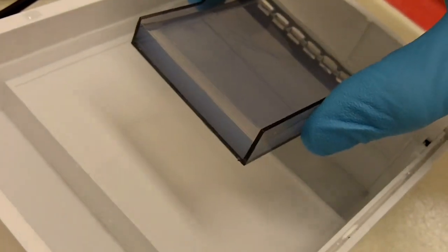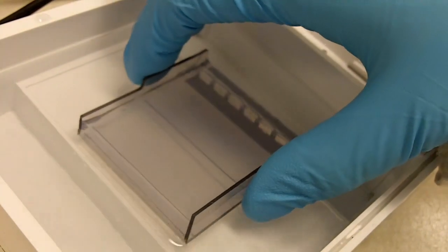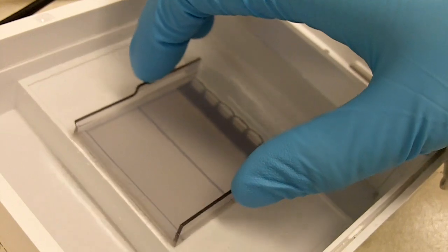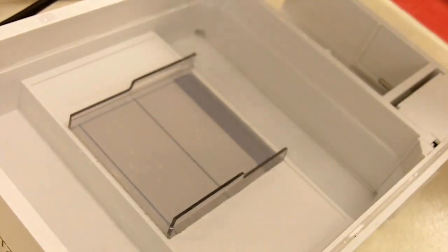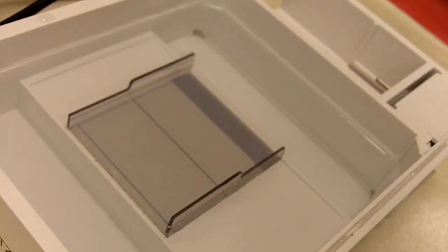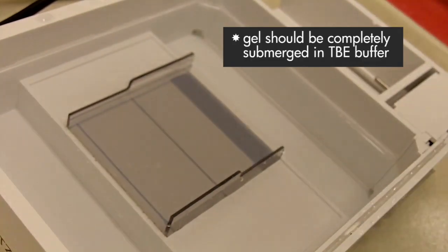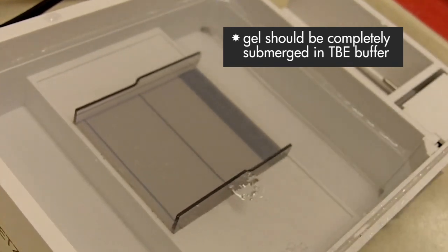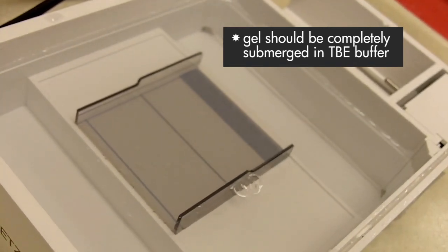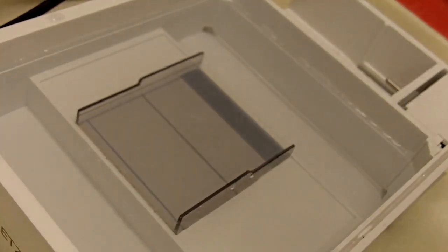Here is the gel tank and I have already poured some buffer in it. We just want to let the gel sit there for a bit and then I'm just going to add in more buffer so the gel is submerged. That's good. Then we are ready to load the samples onto the gel.